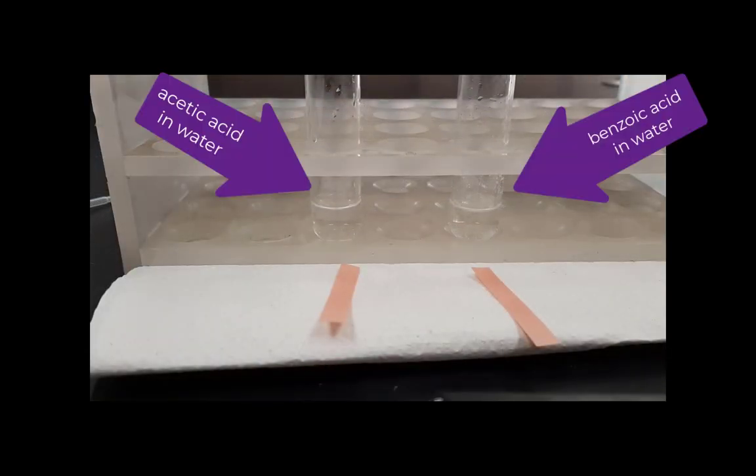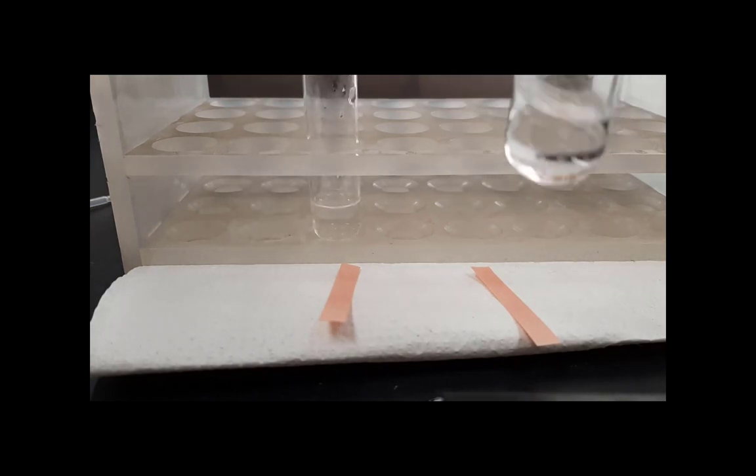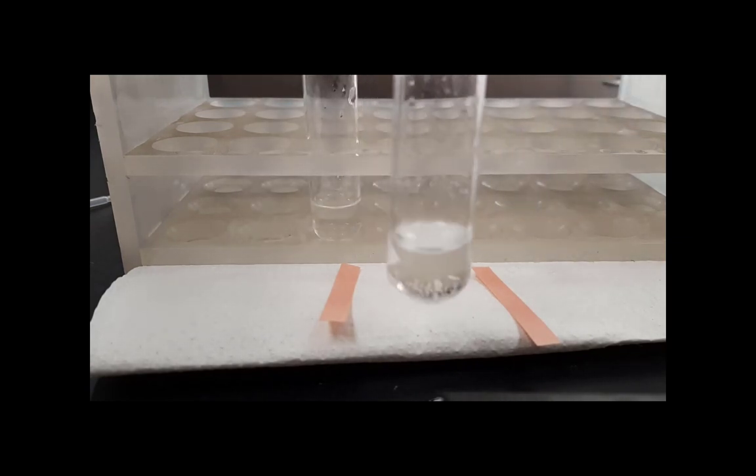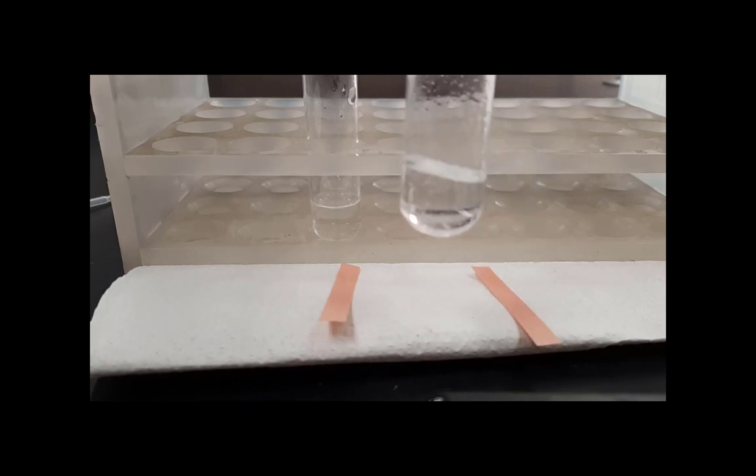I have allowed the benzoic acid solution to cool, and if we take a good look at it, you'll notice that the crystals have in fact come back. The acetic acid has remained soluble throughout, and there are some of the crystals if you look carefully now that the solution is cool. You see the red litmus paper.